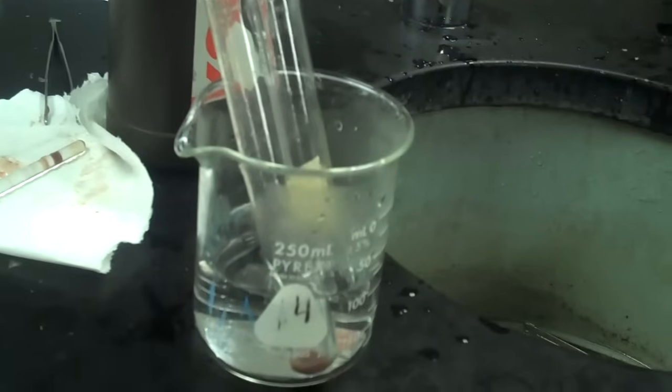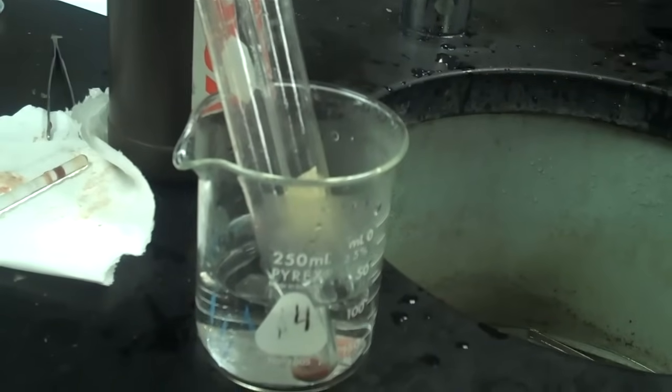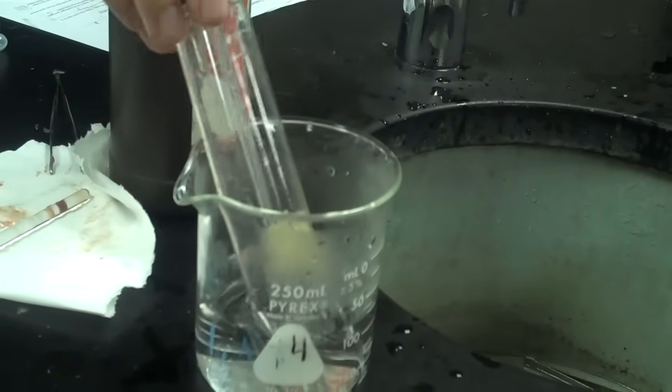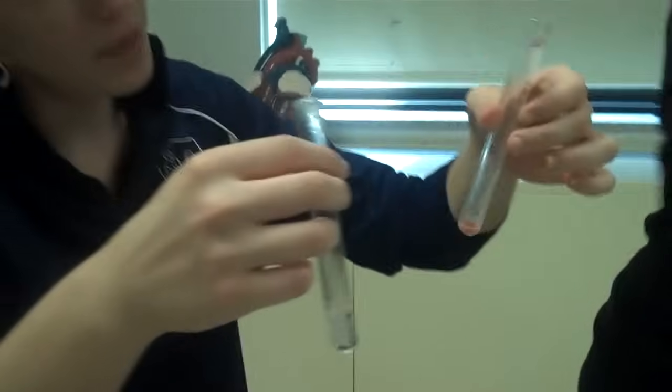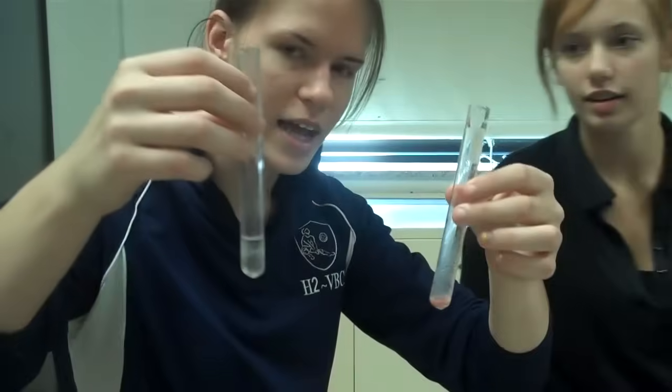So, you have, what's in those two test tubes right there? We have liver in this one and hydrogen peroxide in this one. So, you're warming them both up. Yes. And then, Emily, what have you brought back for us? I have the ice bath liver and hydrogen peroxide.